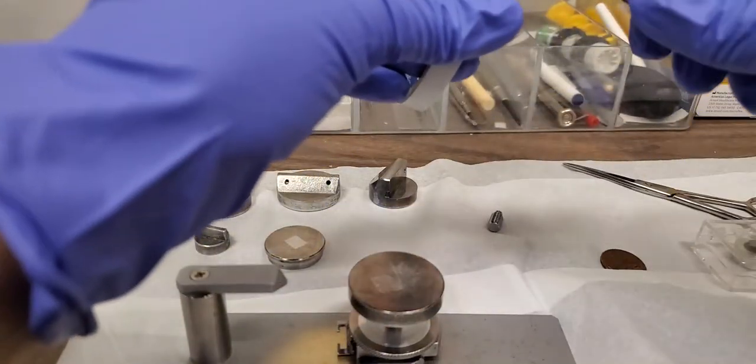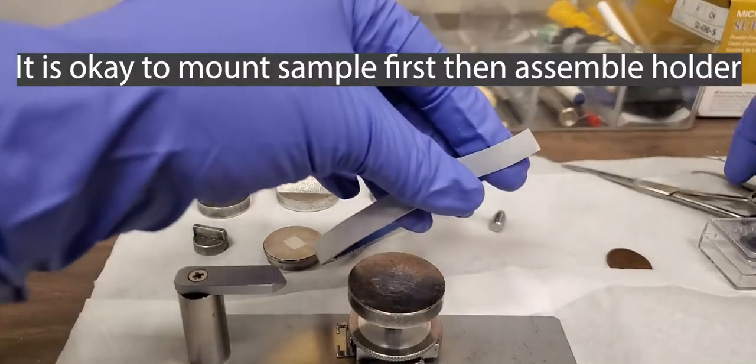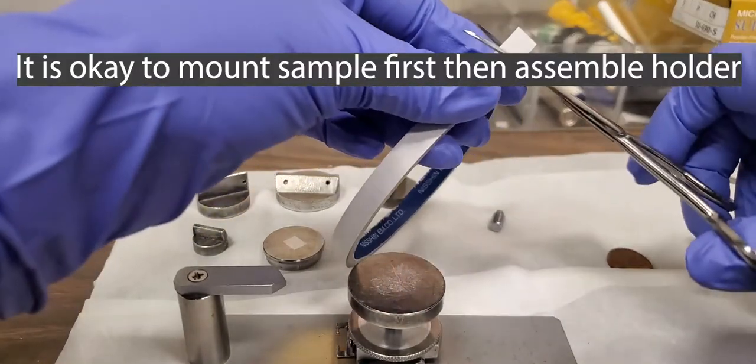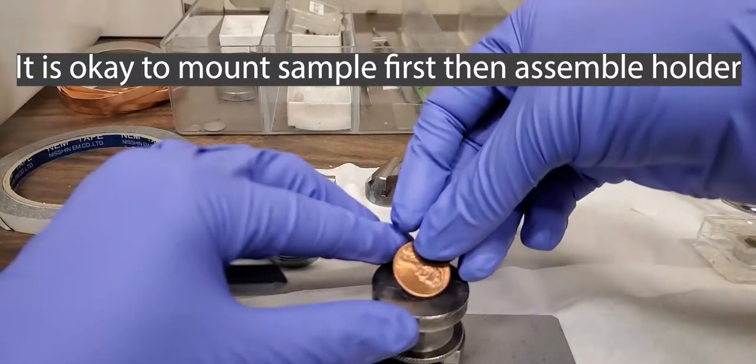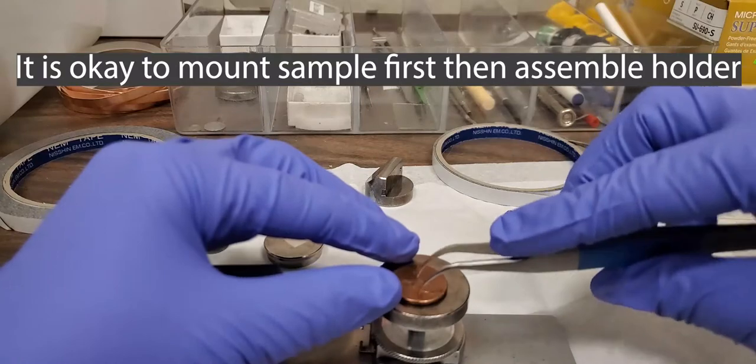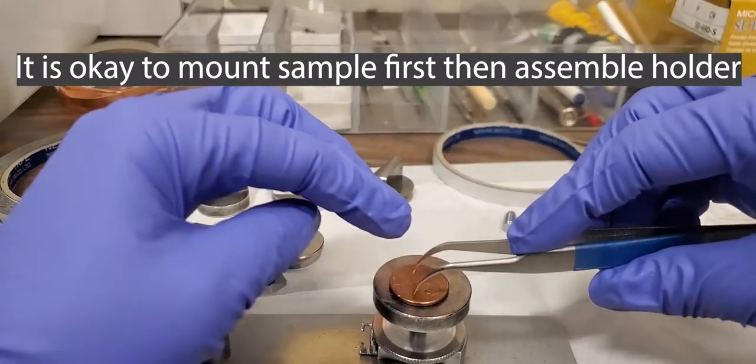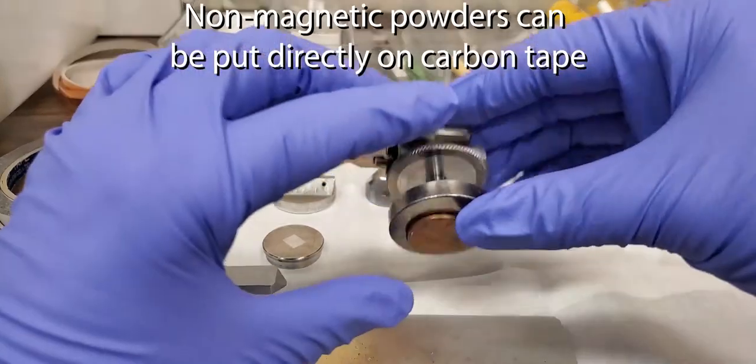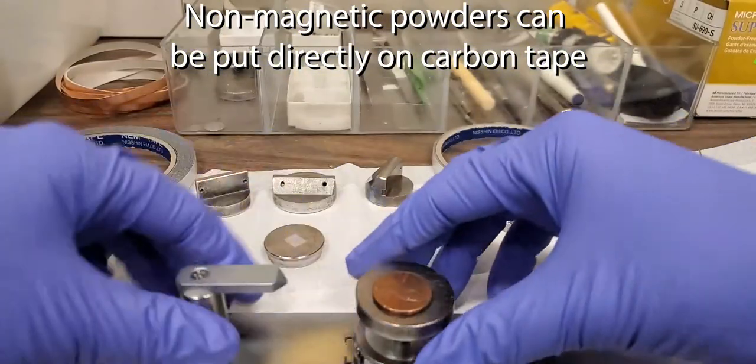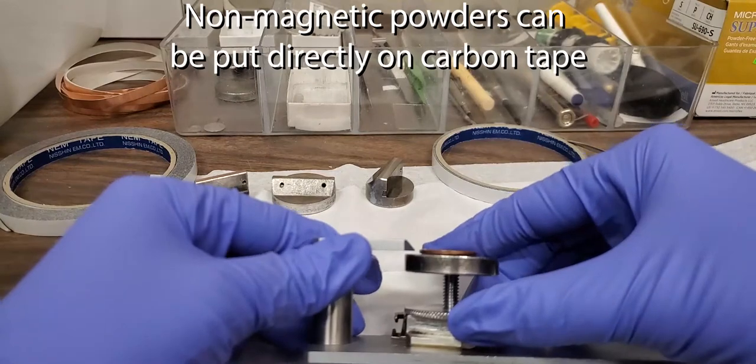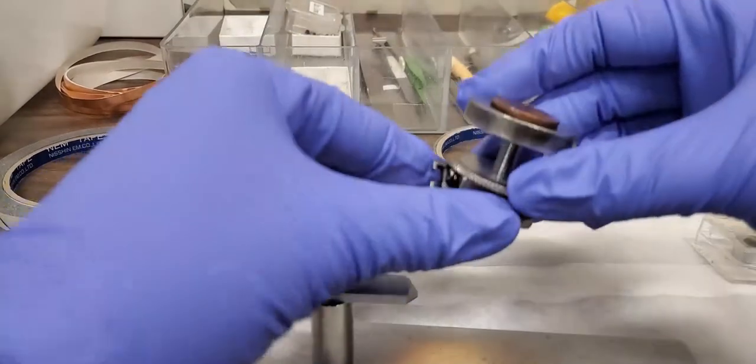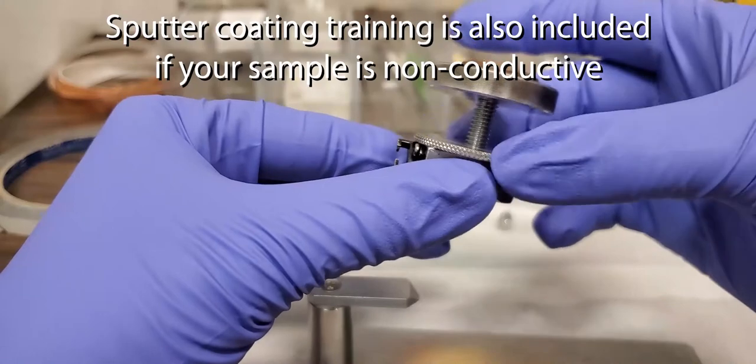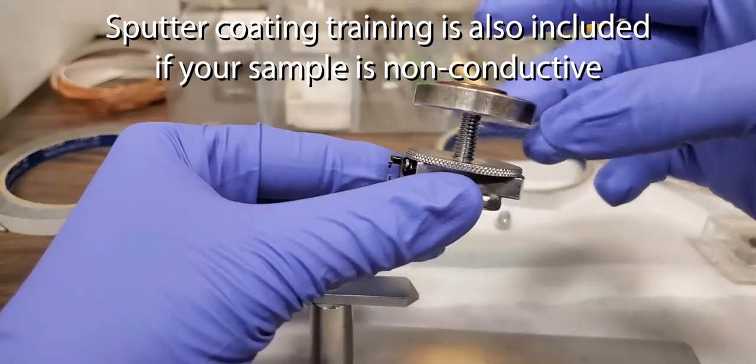Tighten the washer and make sure that it's tight. Try to use a small piece of carbon tape. Make sure it's secure. Check the height. The height is too tall. So we will loosen the washer.